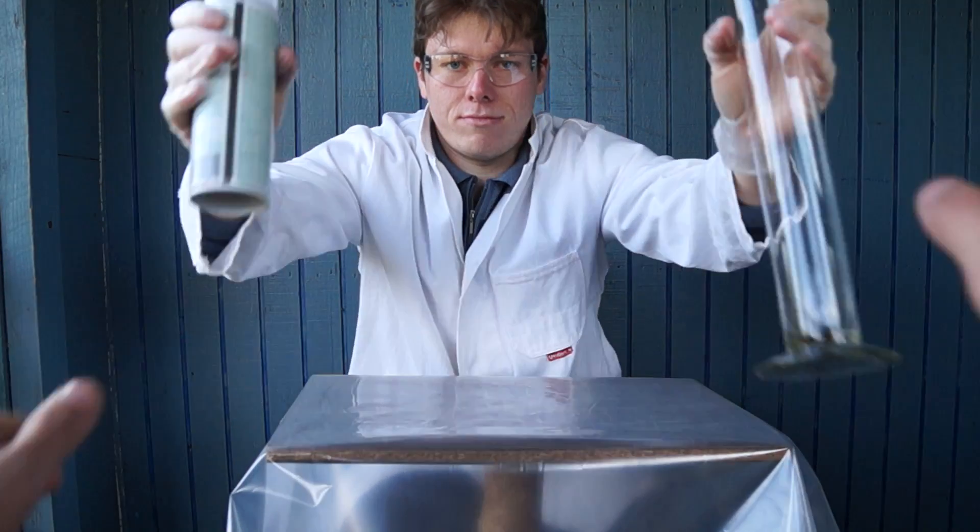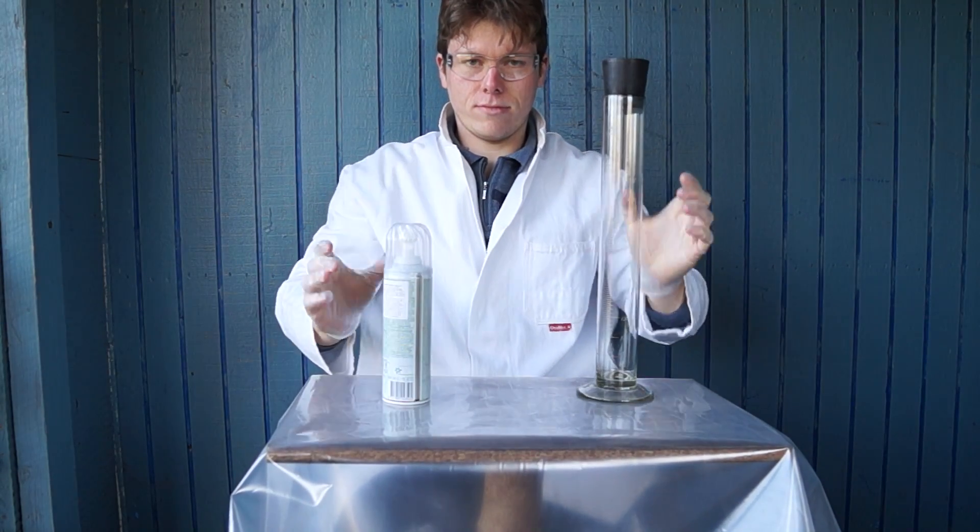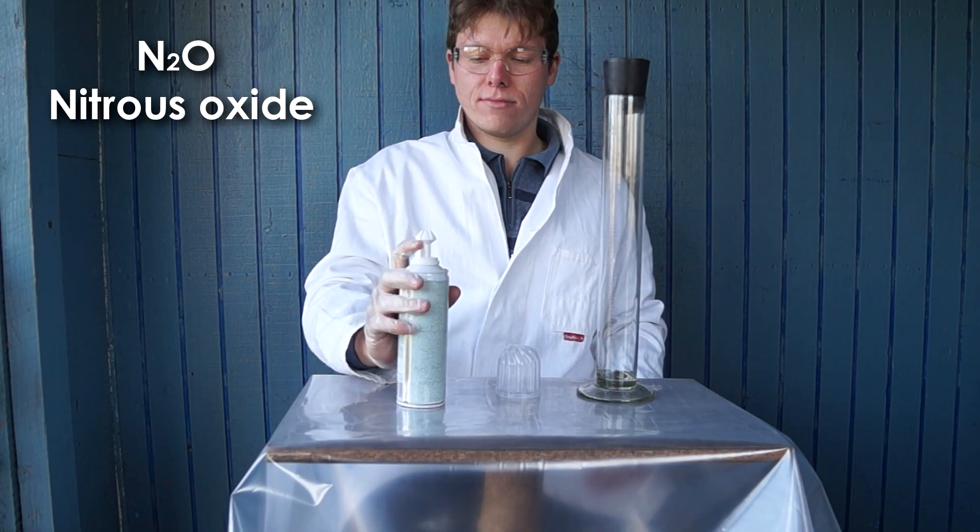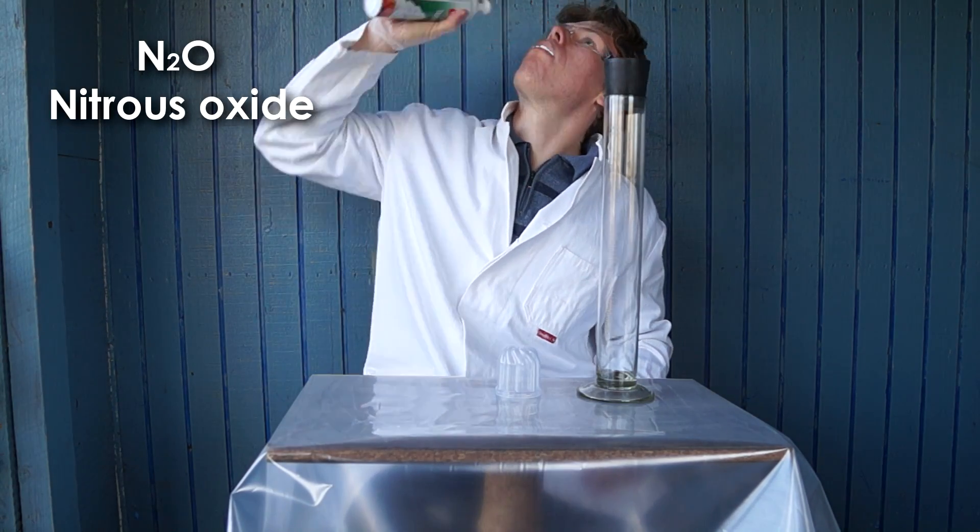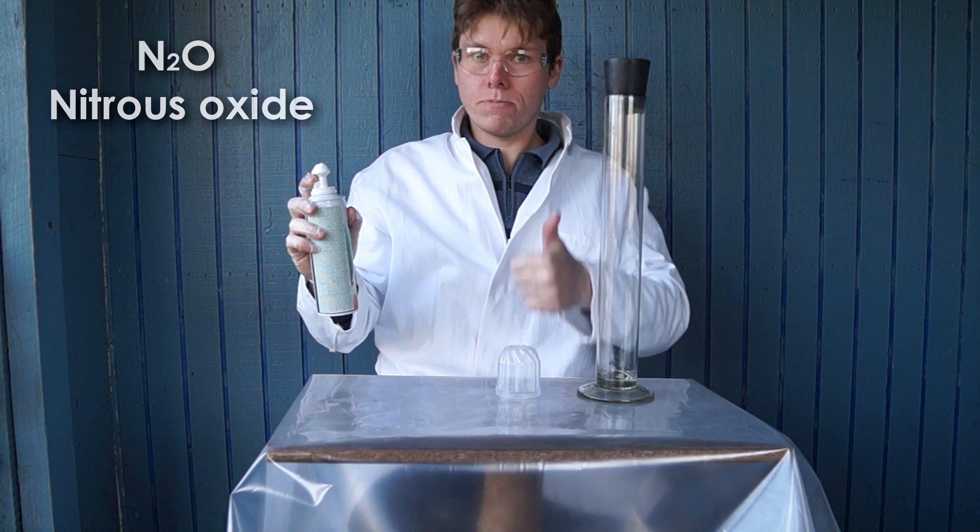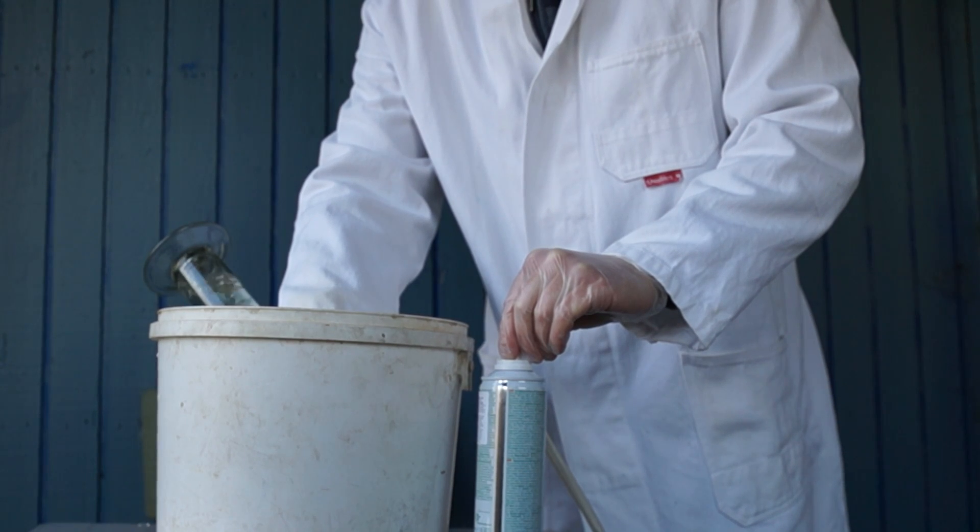To perform this reaction, we need some whipped cream containing propellant nitrous oxide, which we need, and a large cylinder. To begin, let's fill our cylinder with nitrous oxide.